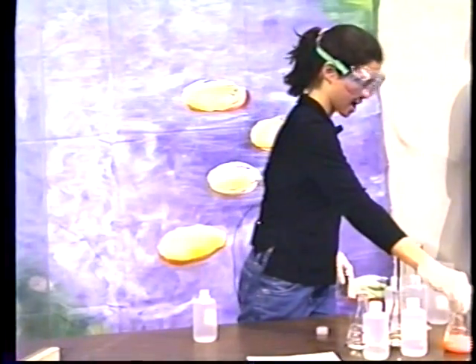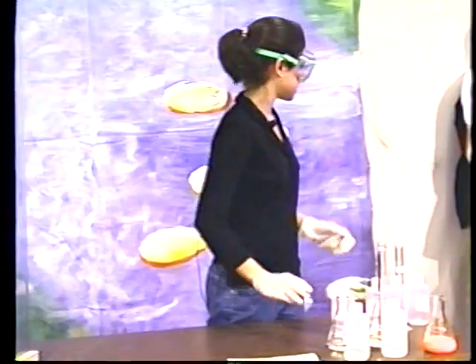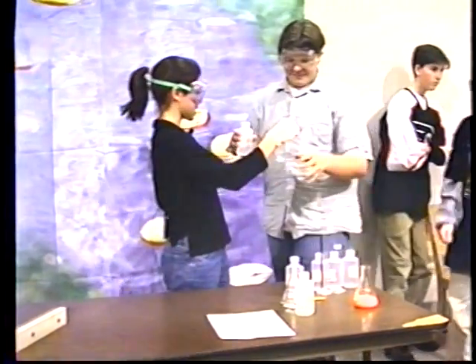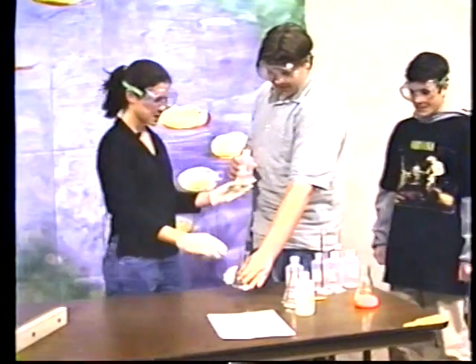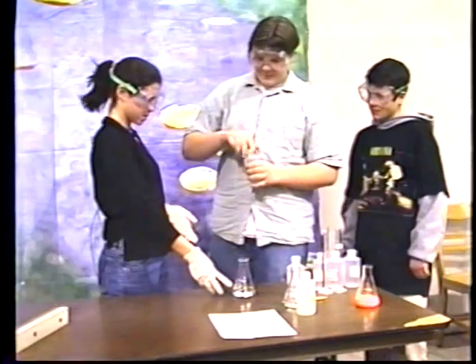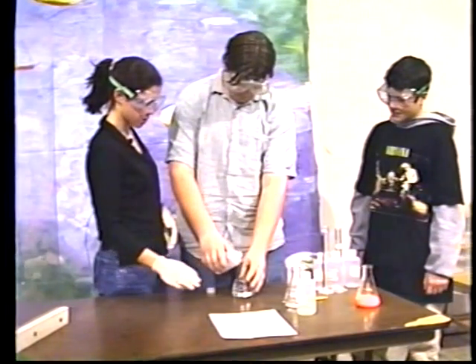Now, I have my volunteers, Zach and Doug. Zach, would you come up, please? Okay. You can try to do this like I did it. All right. Same stuff. They're both the same reactants, and this is the same thing you're going to pour it into, so give it a shot. Make sure you hold it so everybody can see it.